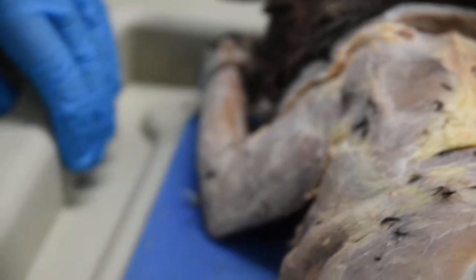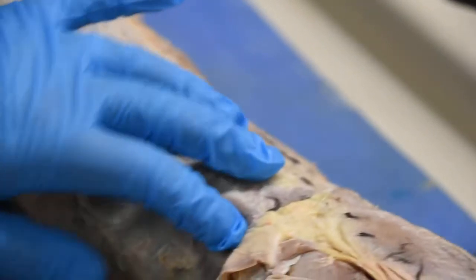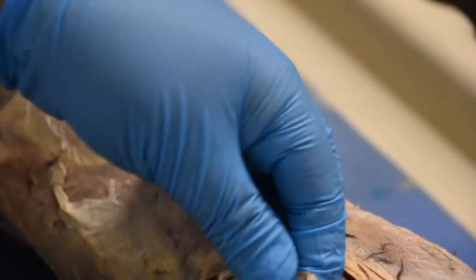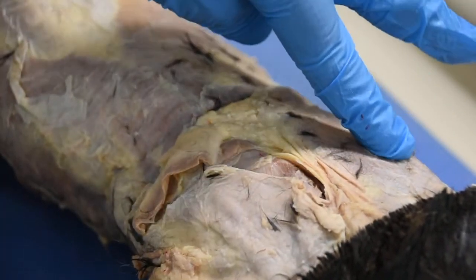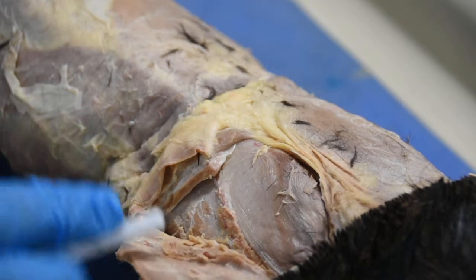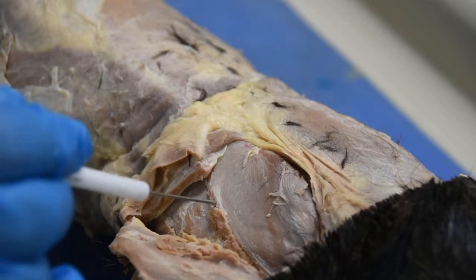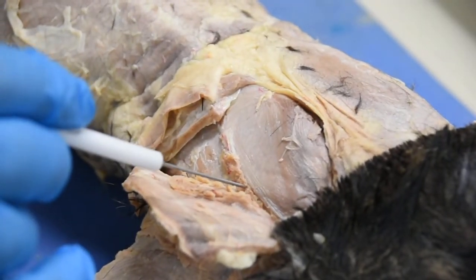Now, what can we find underneath these muscles? If I open up my acromiotrapezius, here's my acromiotrapezius right here, guys. That's acromiotrapezius like we showed on the other side. So we have opened this up and we're looking at the muscles underneath it. What I can feel underneath this, if I was running my finger on it, this line you see right here, this is the spine of the scapula.